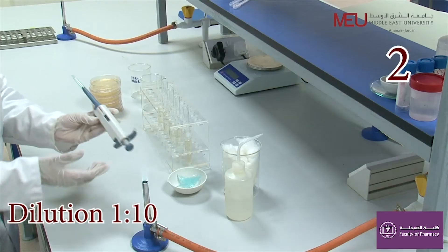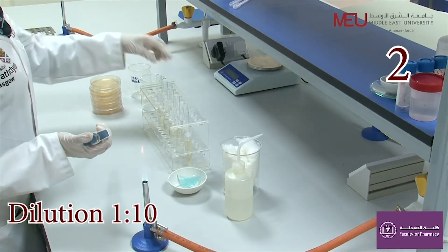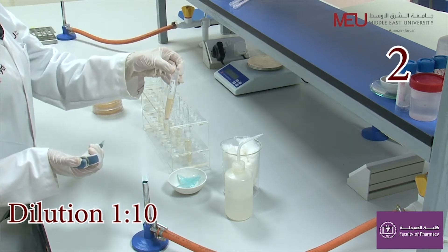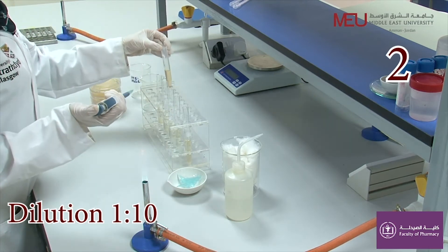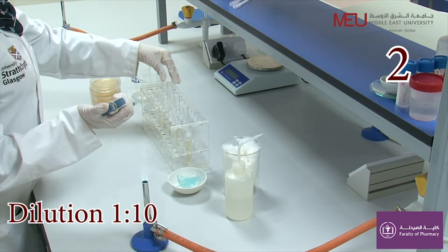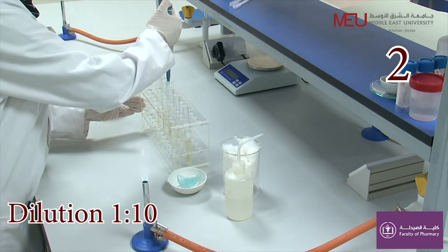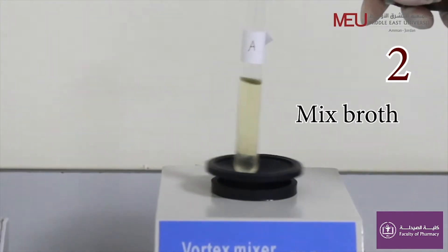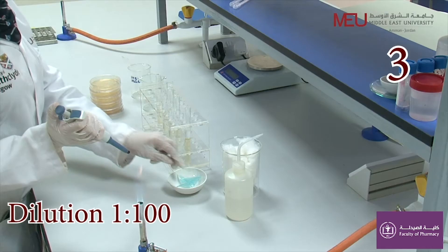Then, transfer aseptically exactly 1 ml into the first test tube from the original sample. You need to mix between transfers by vortexing or pipetting 5 times.